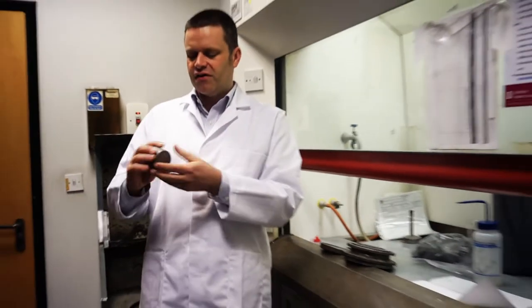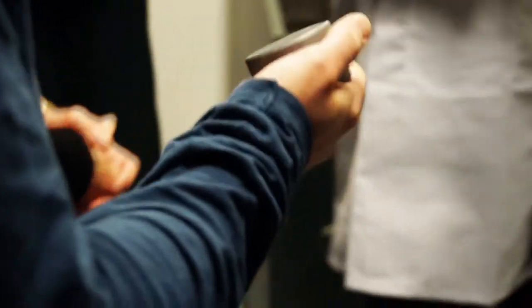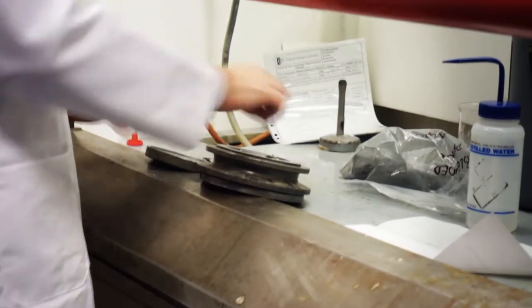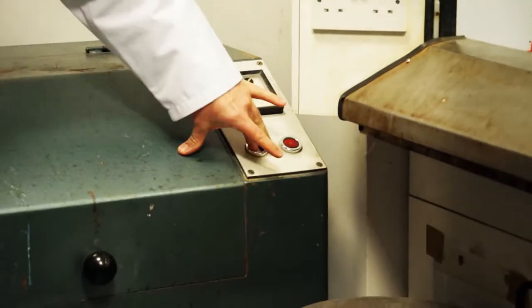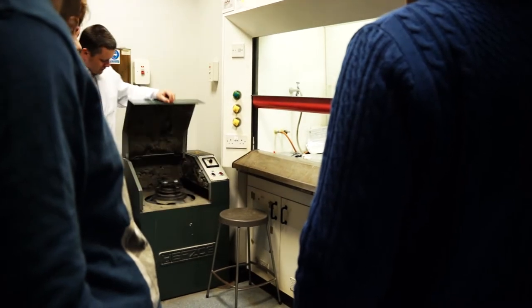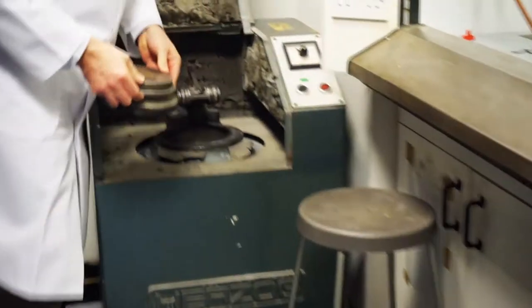So this is a lump of tungsten carbide which is about nearly twice as heavy as steel. We're going to pop the materials in there, put that in there and we'll put a lid on. See this is just a big metal food blender and in shaking it, it makes the heavy tungsten carbide weight vibrate back and forth and that in essence pulverises anything that gets in its way.